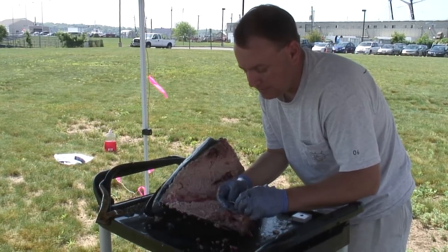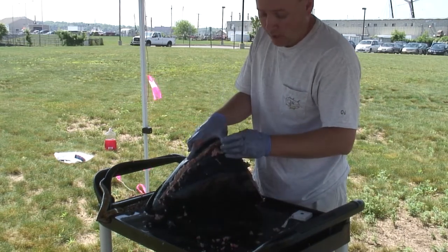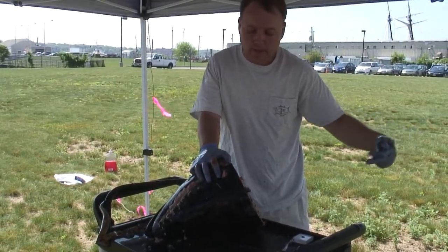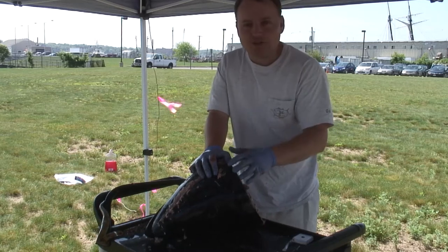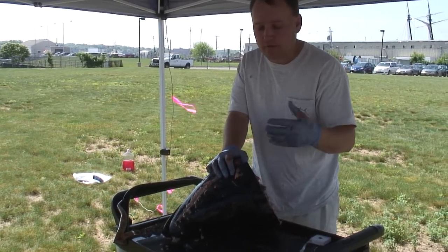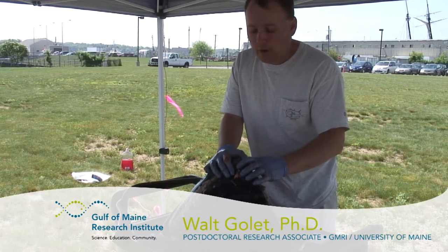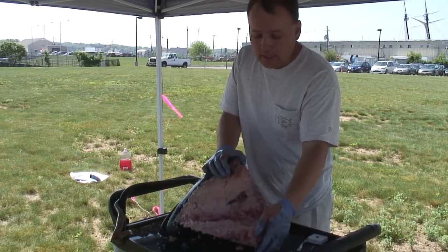That's the second one that comes out, and that's it. The other pieces of data that are very helpful for us is if you can give us a measurement of the fish. For tunas, we typically measure from the snout of the fish along the body contour to the fork in the tail, often referred to as curved fork length. So take the otoliths out, measure the fish, a date of when you caught it, and a general area of capture. Most people are somewhat reluctant to give out exact locations — we don't necessarily need exact locations, but if you can tell us, for example here in the Gulf of Maine, that you caught it on the northern end of Jefferies, or Wildcat, or on the Kettlebottom, it provides very good information even at a broader spatial scale that we can use to look at how catch locations and composition of catches are changing in our area and in other areas.